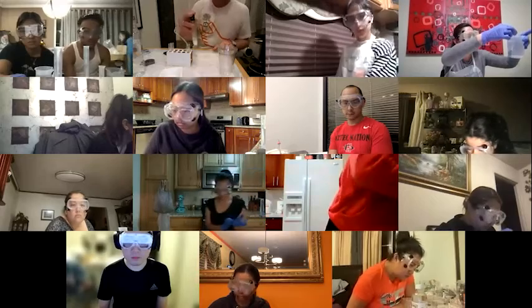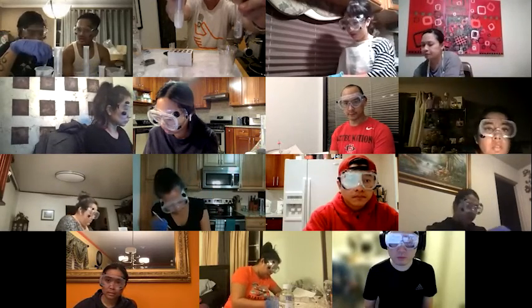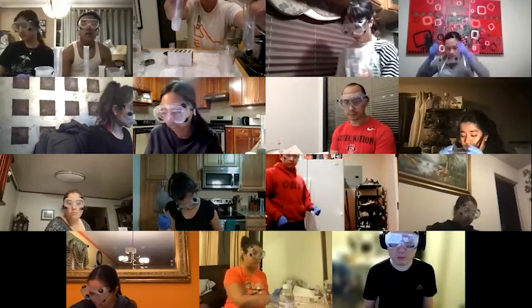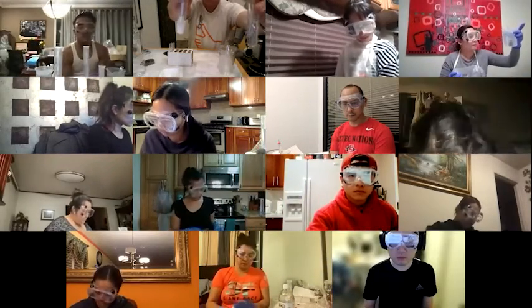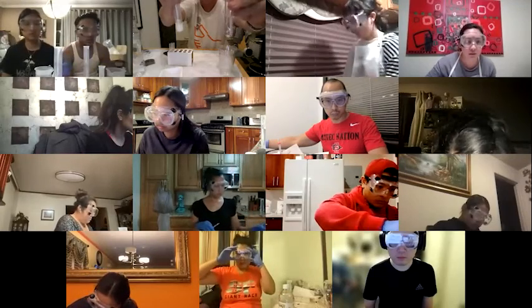Yeah, so every time I tip this to mix the bicarbonate and the acetic acid, I get a big reaction. Watch. It starts bubbling like crazy. Tip it, starts bubbling like crazy. So I think maybe our problem was we weren't taking enough time to let this take place. But you can already see that one clear indication that a reaction is taking place is what? Bubbles. And what do the bubbles mean? Gas production. That's right.